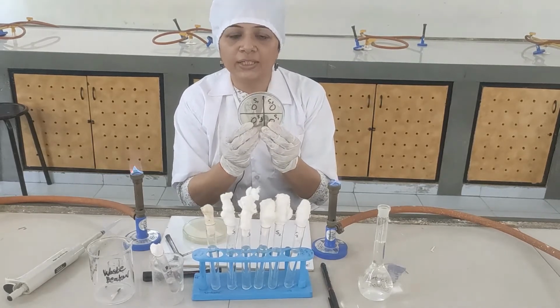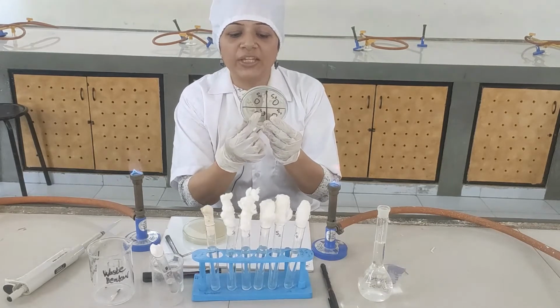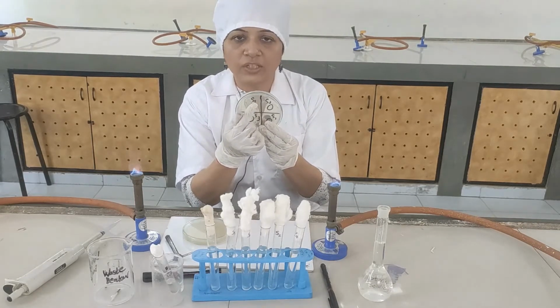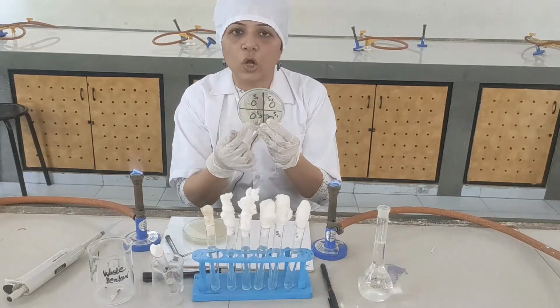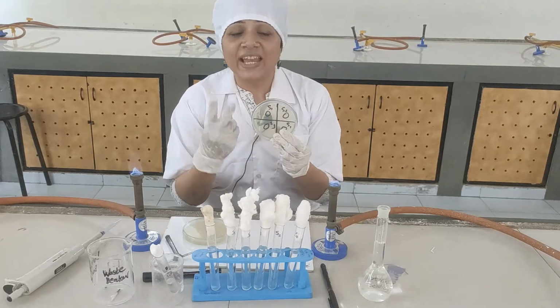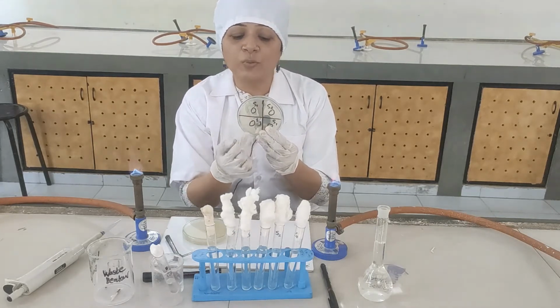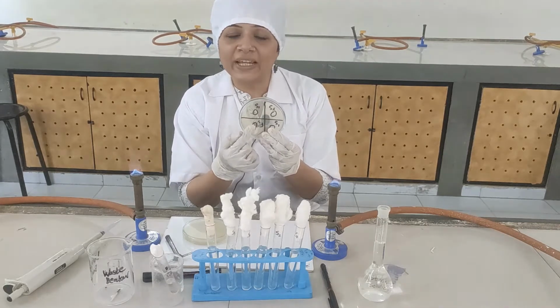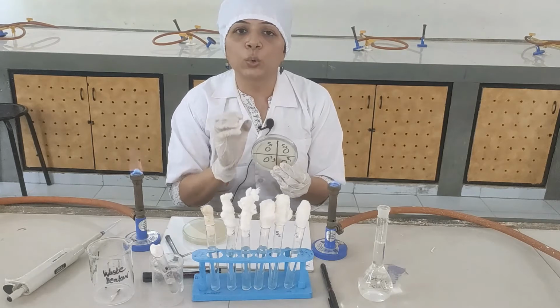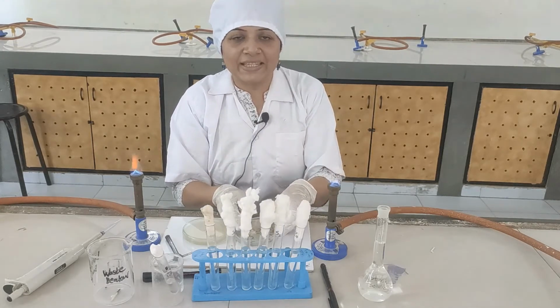in the theory. So 4 sections you have to make. S3 is your median concentration, S1 is your first standard concentration. So S3 is to be used in all the plates. So in the first plate there will be S1, S3. In the second plate there will be S2, S3. In the fourth plate there will be S4, S3. In the fifth plate, there will be S5, S3 and then there will be unknown and S3. Like this, you have to label all the plates.